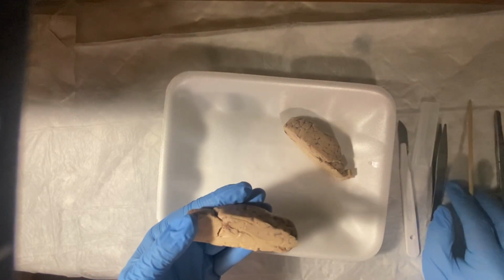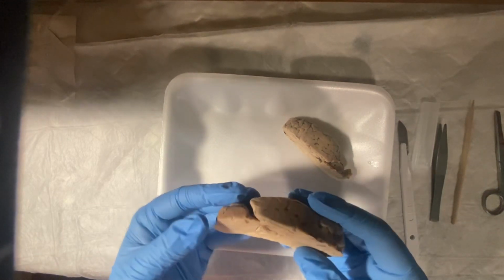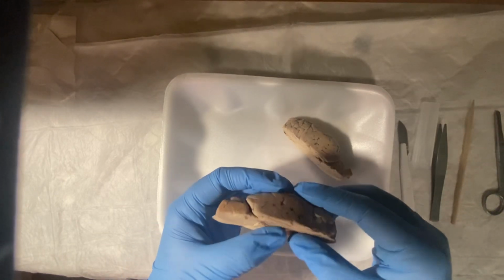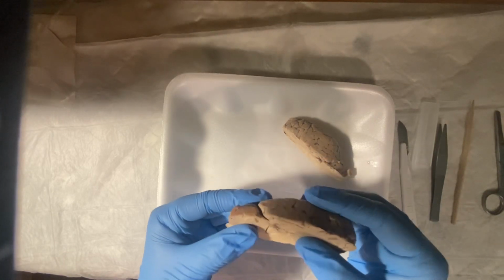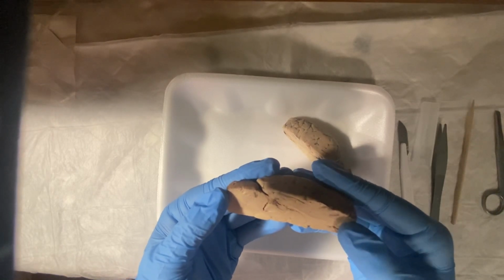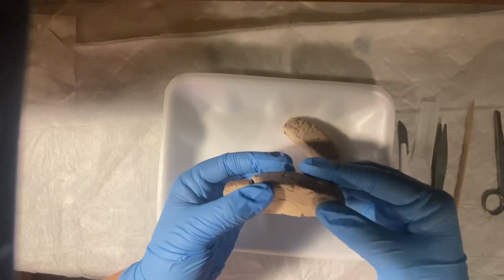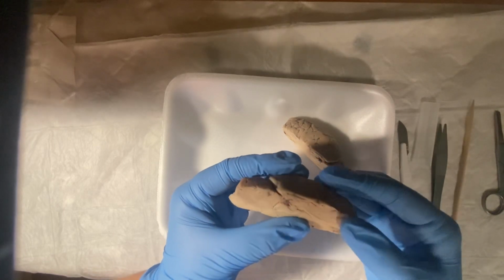Okay, and now let me talk about the corpus callosum, and that would be the loop. Let me look for it. The loop, mine's kind of hard to see, but it kind of looks, I've heard, like an upside down Nike sign.